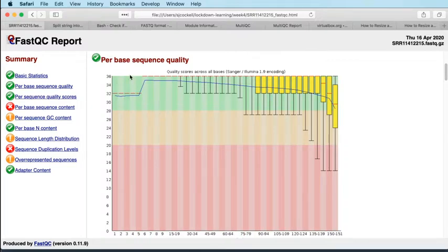What FastQC is looking for with this report, in order to get a green tick, is that the median, that is the red line in the middle of the boxes, never falls out of the green zone. As long as the red line is in this green zone, then FastQC is happy. If the median falls below that green zone, then you might have reason to take a slightly closer look at what's going on with the quality of your sequencing. Bearing in mind that the green line here is drawn at 28, and a quality of 30 is a 1 in 1,000 probability of error for that particular base call. So I think we can say that the quality of this data is pretty high.